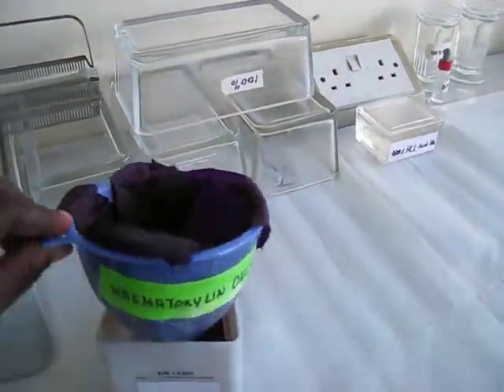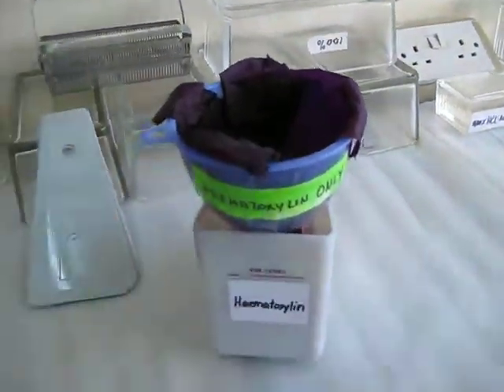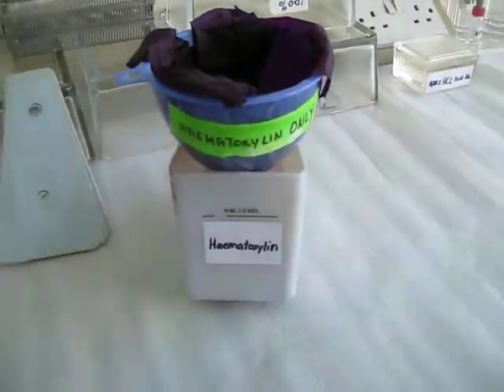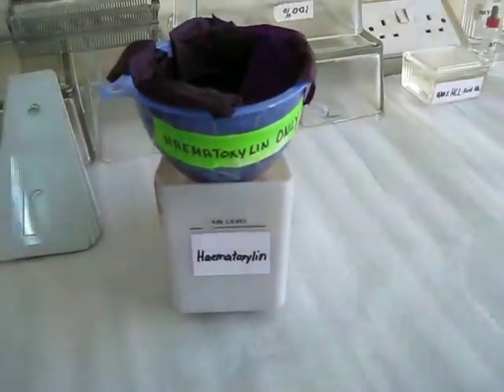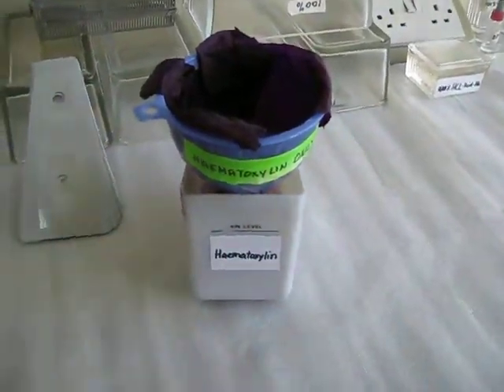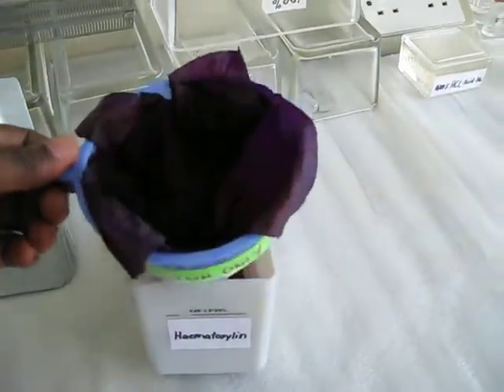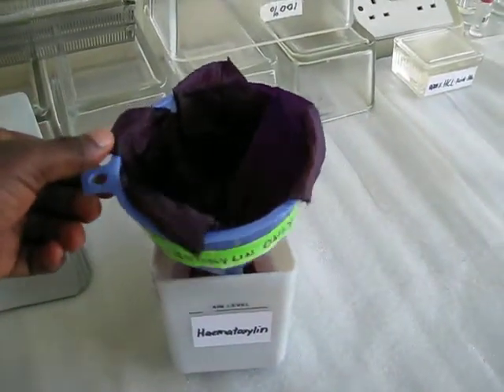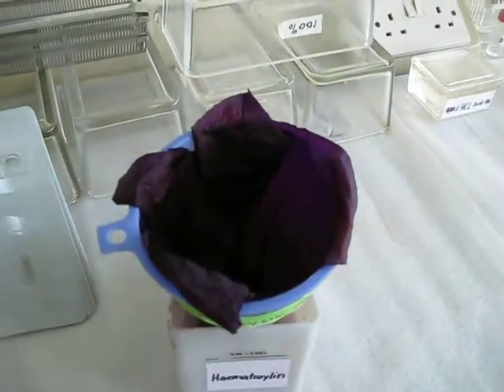You have a funnel labeled hematoxylin only, with a hematoxylin container — any type of container that is deep enough to accept a slide rack is appropriate for this. You have to filter the hematoxylin every morning to avoid any crystals that will form artifacts on a slide.